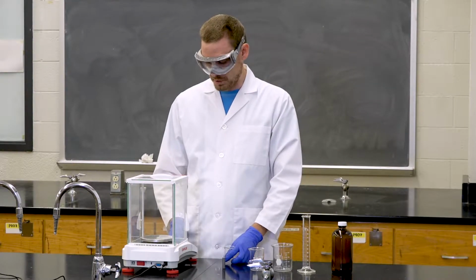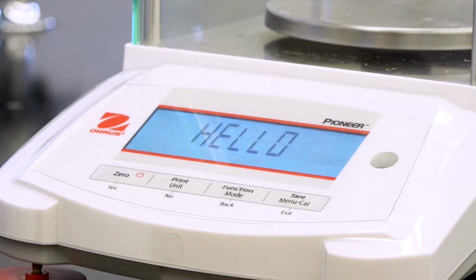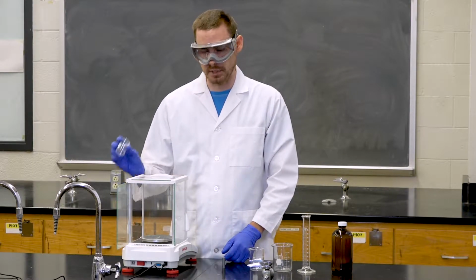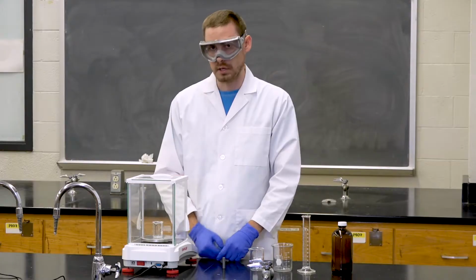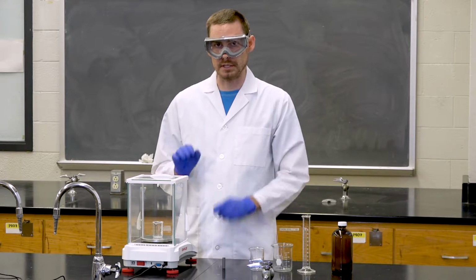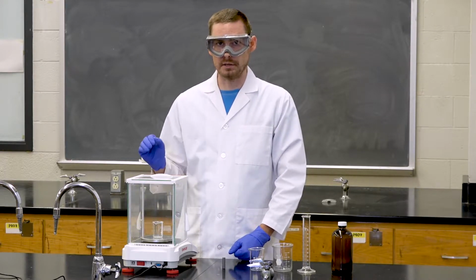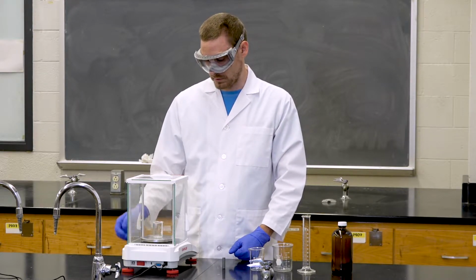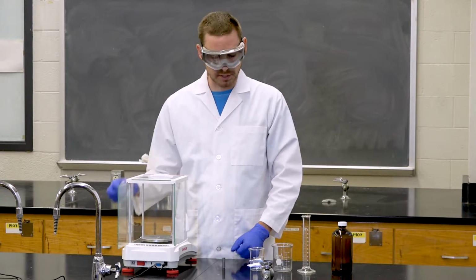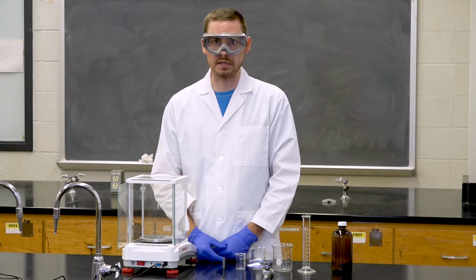To begin, make sure you turn on the balance by hitting the power button, which on this balance is also 0. You want to open one of the doors and place the beaker that you're going to be measuring on the center of the balance, and then close the door. You can then wait for the measurement to stabilize before making your recording. Once you make your recording, make sure you write it down in your lab book using all of the digits that are given to you on the balance. You can do this same procedure with a second beaker, and then again using a watch glass and a stopper and whatever else you need to measure within your lab book.